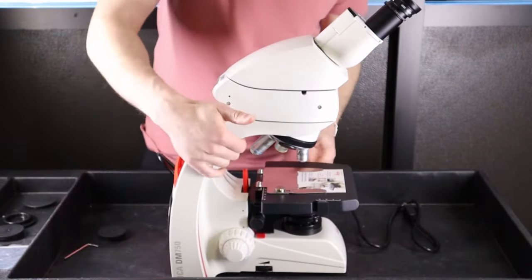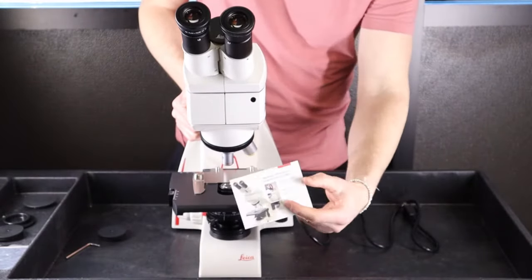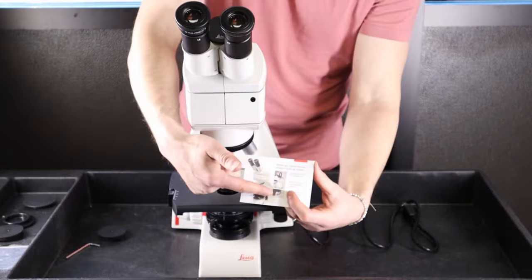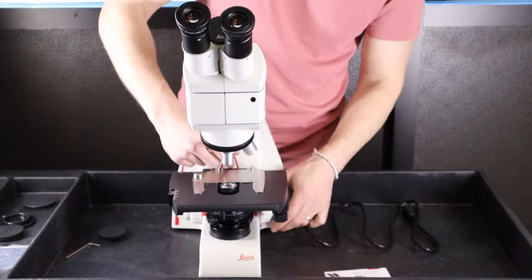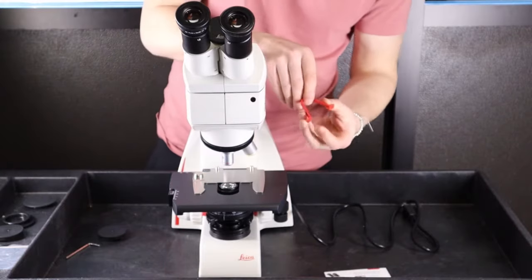The next step is to remove the safety locks. There's a card on the stage which shows you where the safety locks are located. The first one is going to be a pinch and squeeze to simply remove the top one.